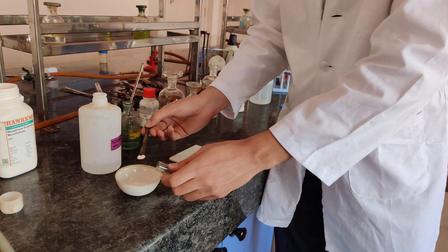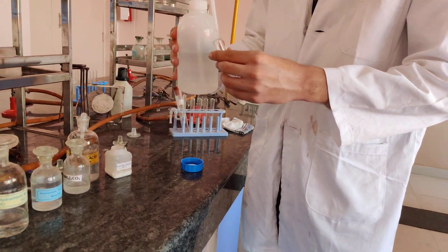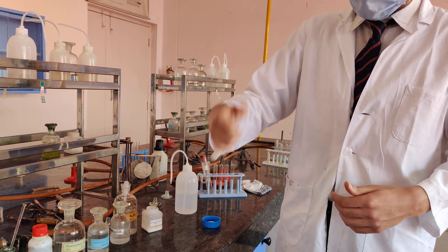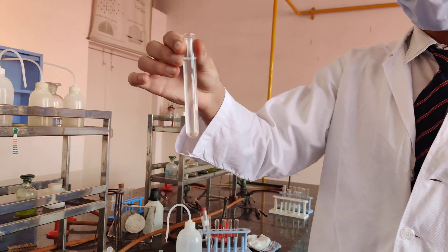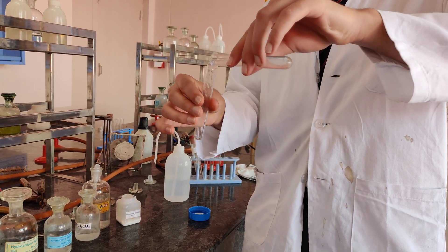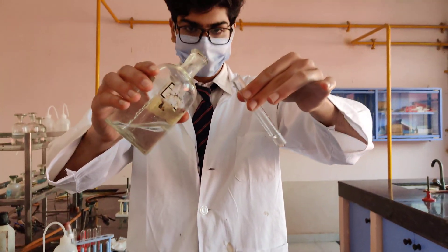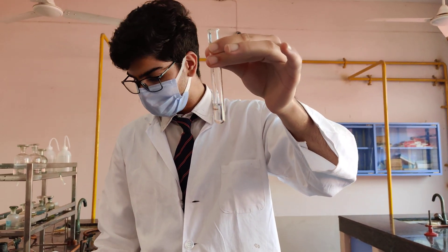Proceeding with group 1, he needs to prepare an OS. OS is prepared by taking a pinch of salt, adding distilled water, and making a solution — at least one test tube full, as you will be using it again and again. He will take 1 ml of this solution and proceed with group number 1. To test for lead, he adds dilute HCl. There is no PPT, so group 1 is absent.